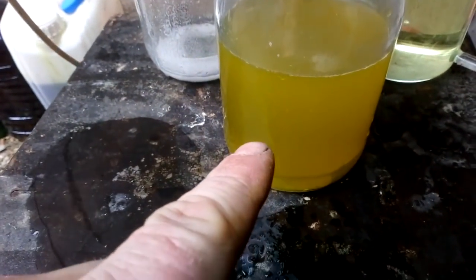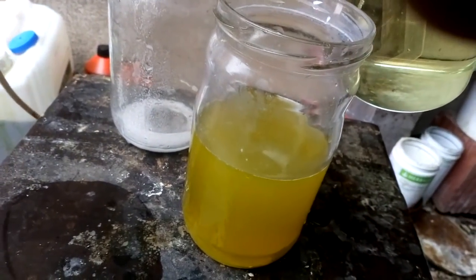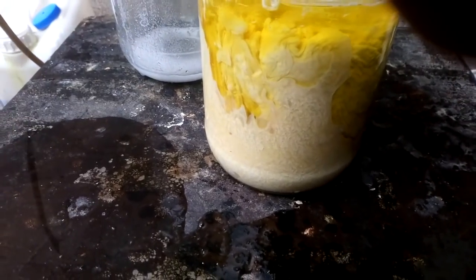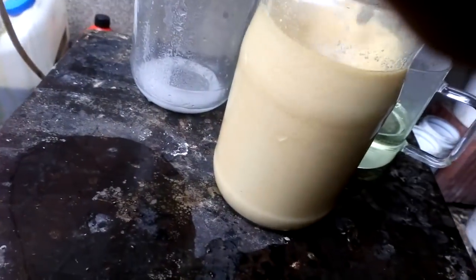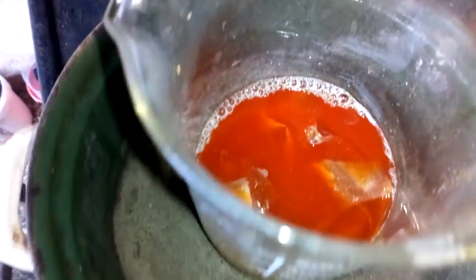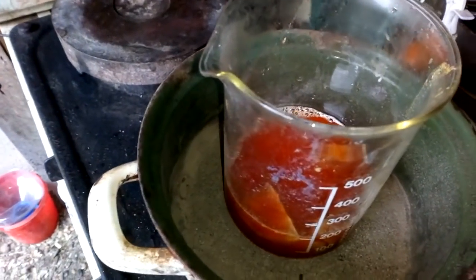Now later we will drop that palladium from that solution, so I will drop that silver with HCl to make some aqua regia. See that? It's beautiful. I made some aqua regia from that contact, and now I will put that on low heat. I just put that in, so I will turn on the heat and recover that.